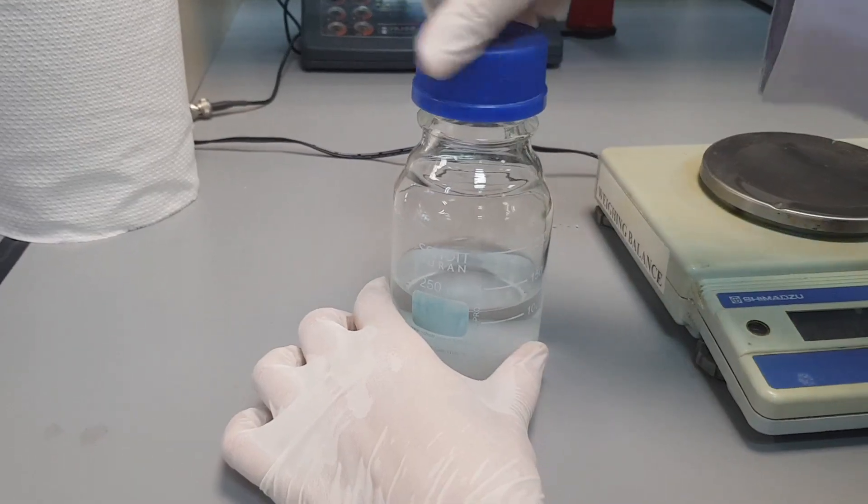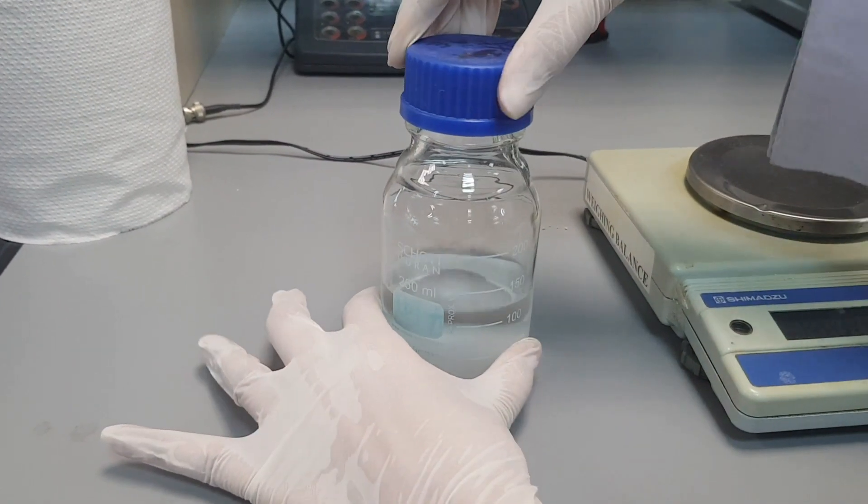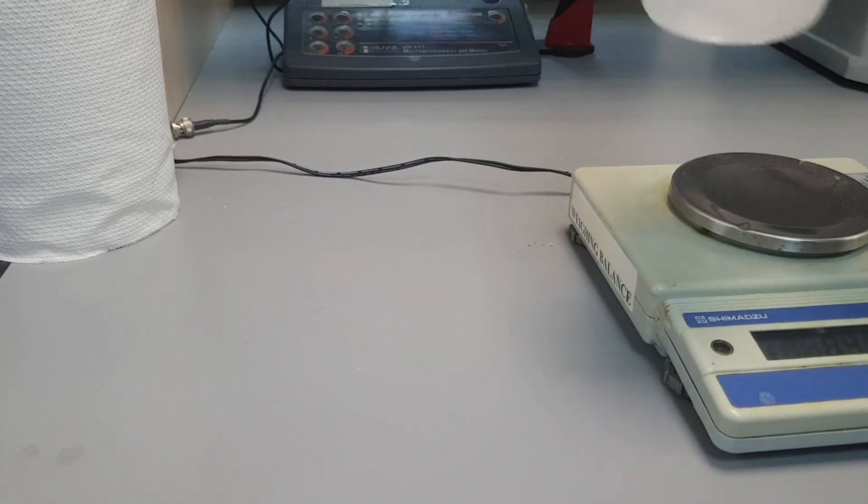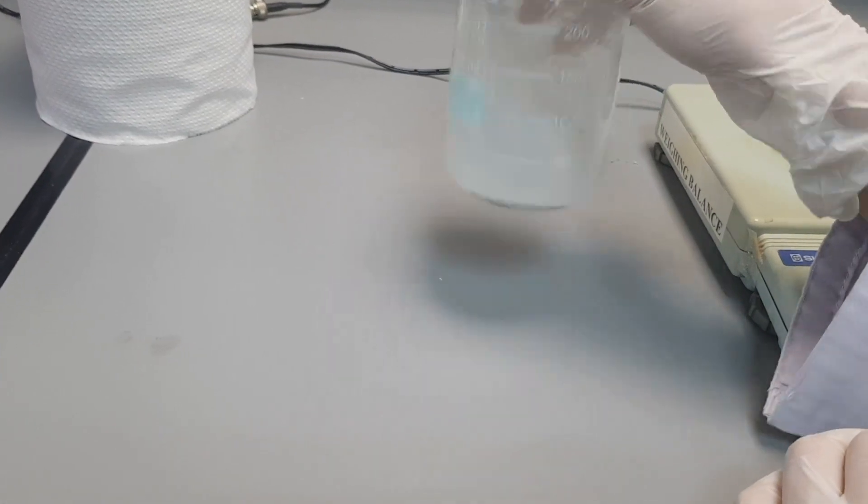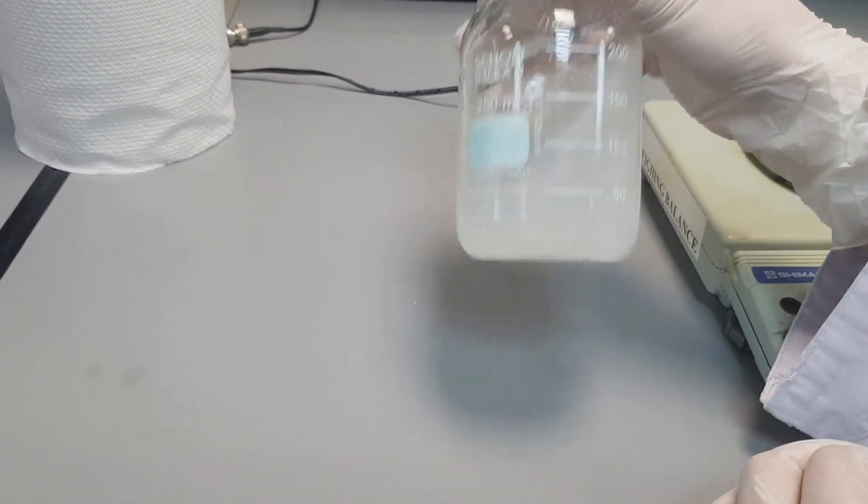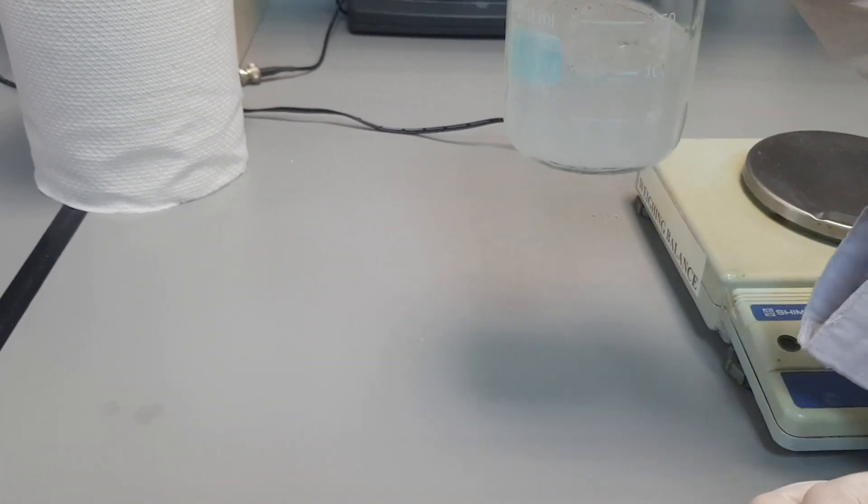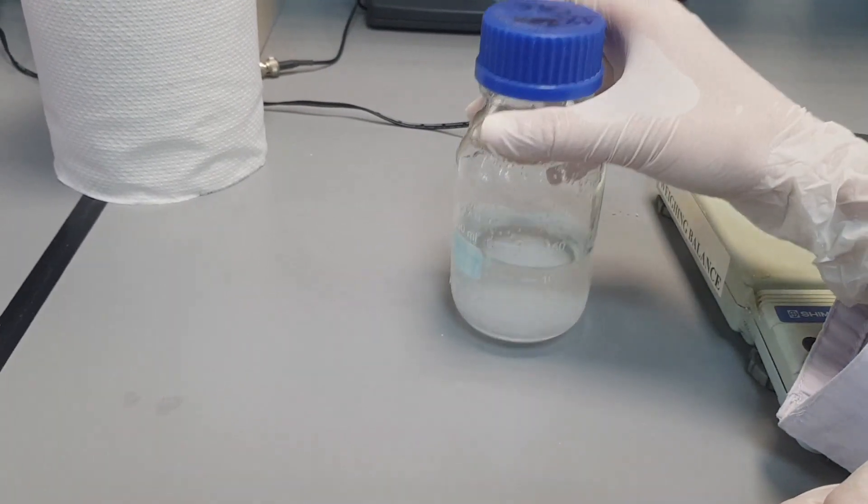Mix the reagents well by gentle shaking. Make sure all of the ingredients are well dissolved. A completely dissolved solution looks transparent while a partially dissolved solution will appear turbid.